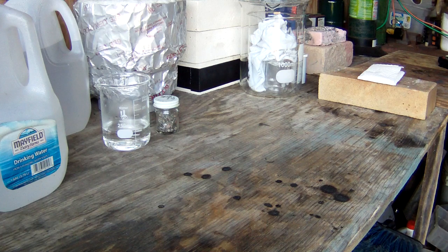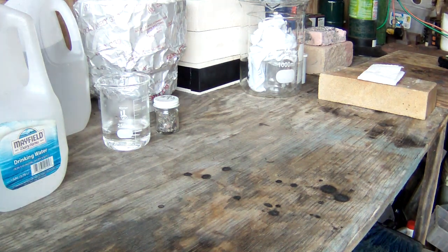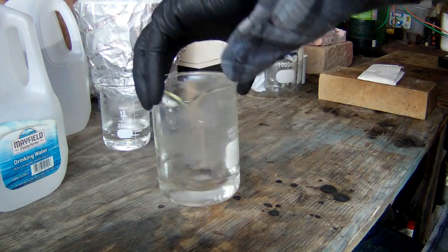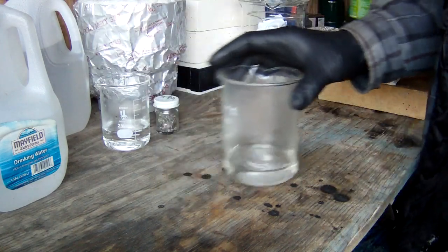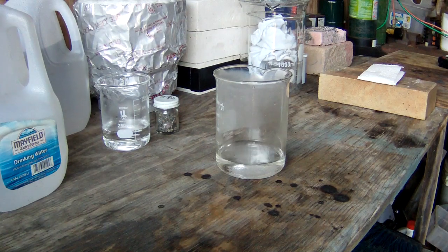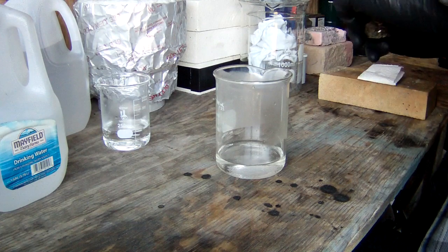Alrighty guys, well, we're back. Our water's got pretty warmed up. So I'm going to go ahead and set that off over here, and it is pretty cool out here today. So I'm going to have to end up probably doing this on the burner or on the warmer just to keep the action going because it is cool out here.